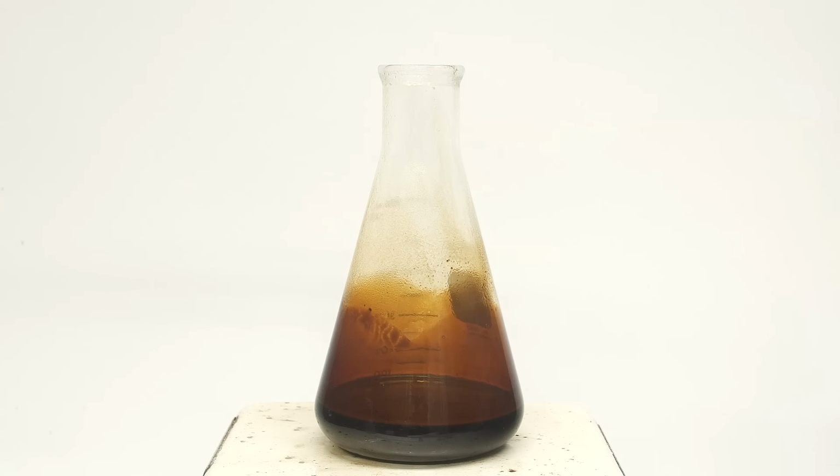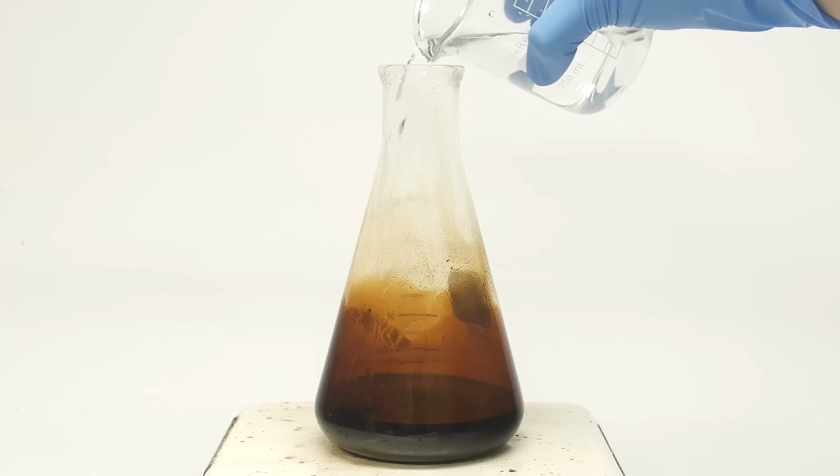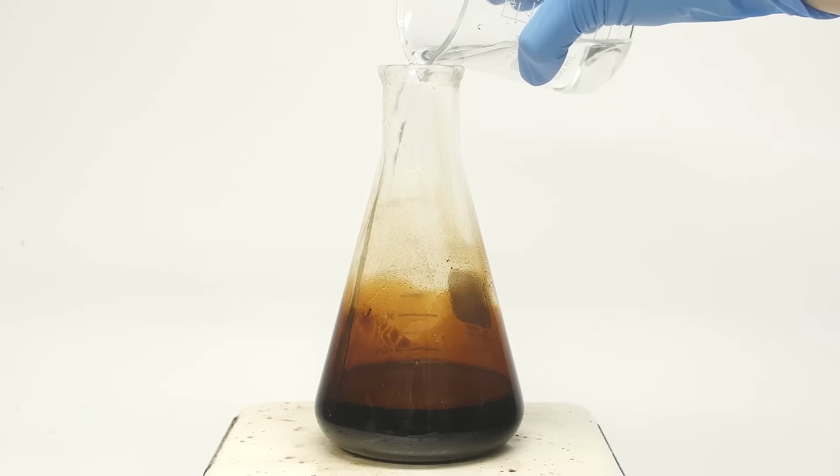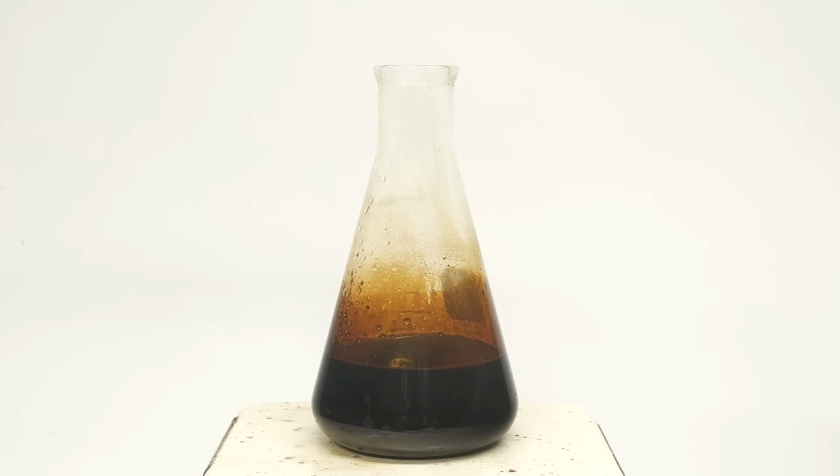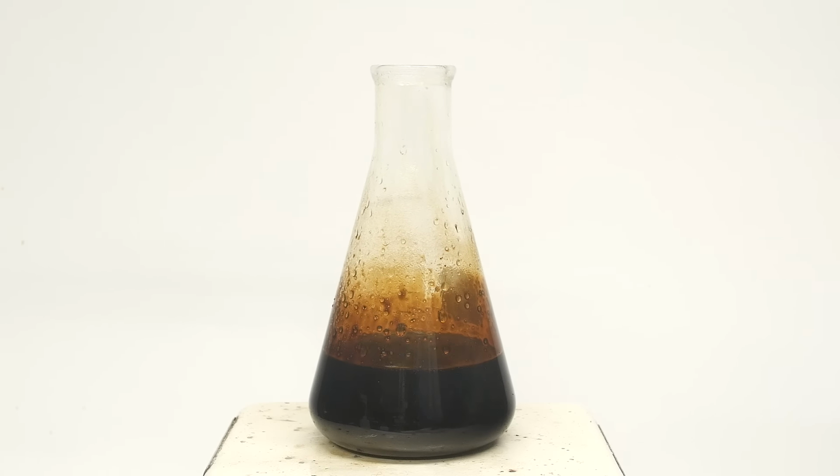The first thing to get rid of is the zinc chloride catalyst. Zinc chloride is very soluble in water, so it should be pretty easy to wash out. It's important to remember that this reaction is reversible, so when water is added, we could start to get some ester hydrolysis. At room temperature, and with such dilute conditions, this shouldn't really be a problem, but it's still best to go as fast as possible.